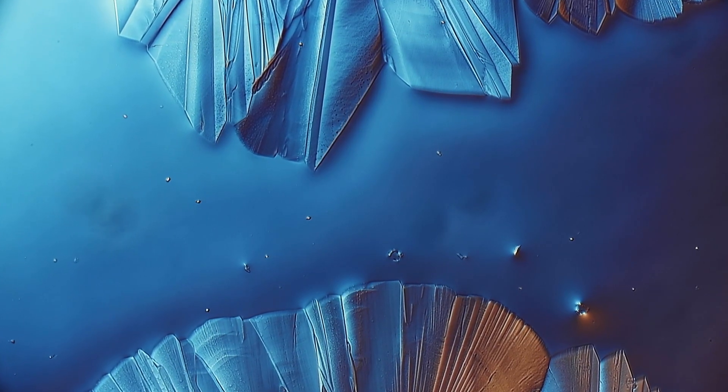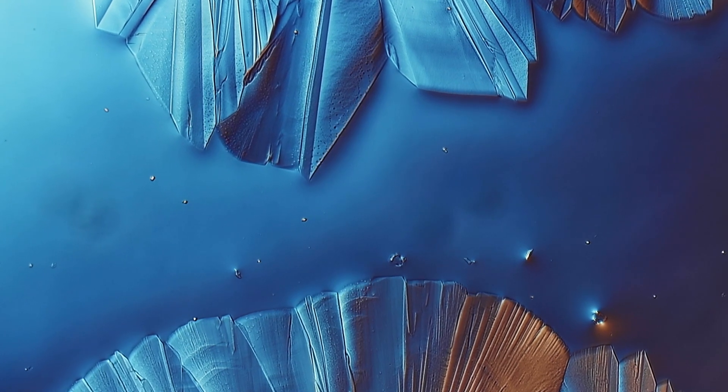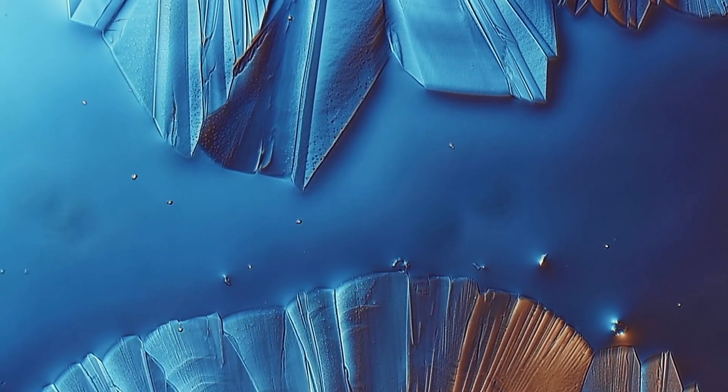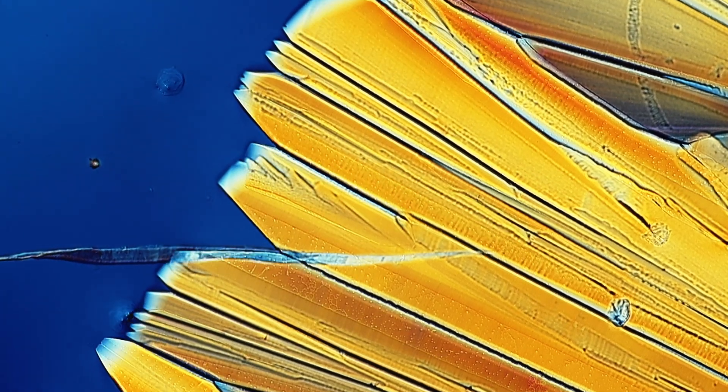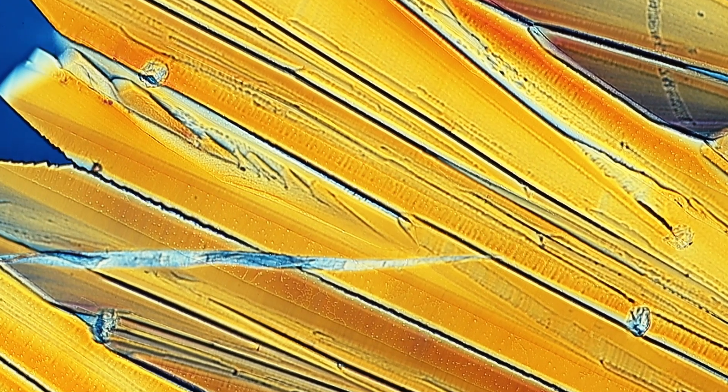How you can put them under the microscope yourself using very simple techniques, I would actually say maybe even a little bit too simple, and also very cheap. The effects are absolutely stunning and beautiful. I mean, of course I do not have to say that I also printed them out and put them up on my living room wall, and you can also make some greeting cards using those beautiful patterns.